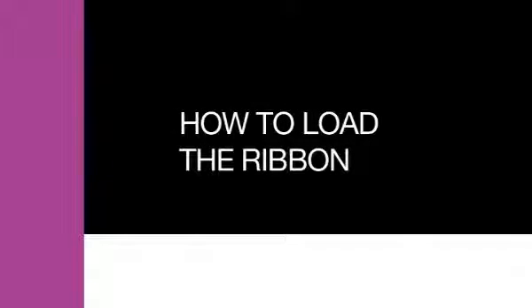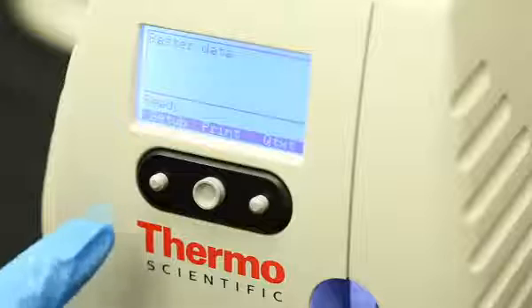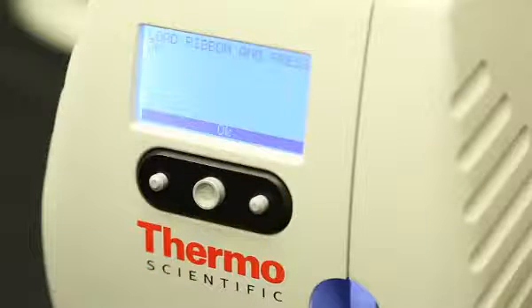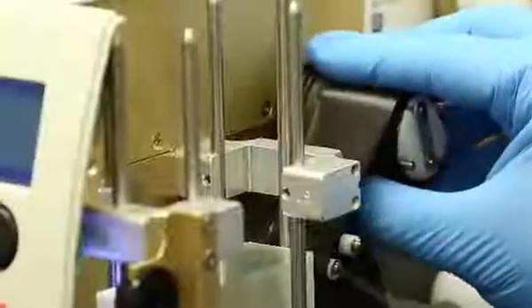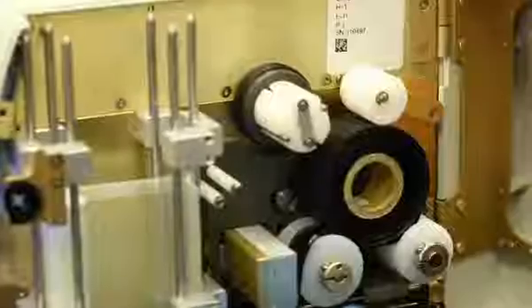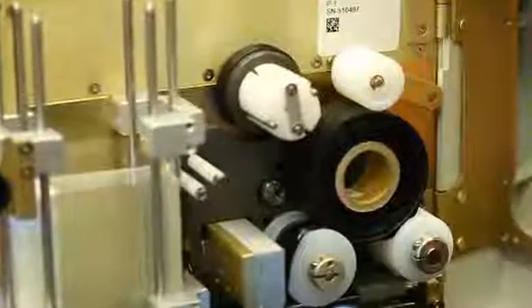How to load the ribbon. To change the ribbon, press the Setup button on the front of the SlideMate. Press Load to release the tension from the ribbon. Cut the ribbon and pull the used ribbon off and discard. Make sure the unused ribbon is sitting on the two ribbon support rollers.